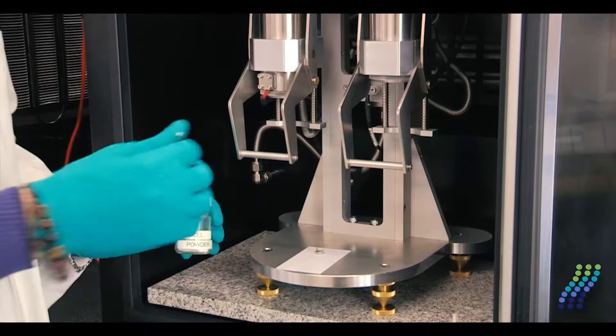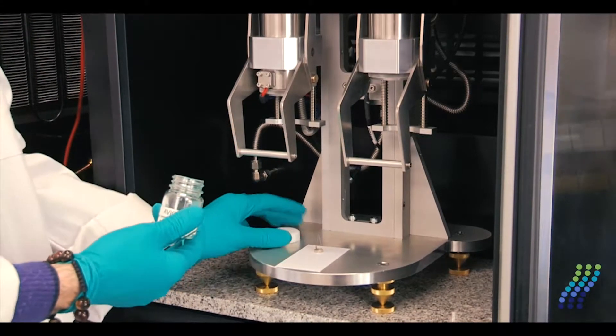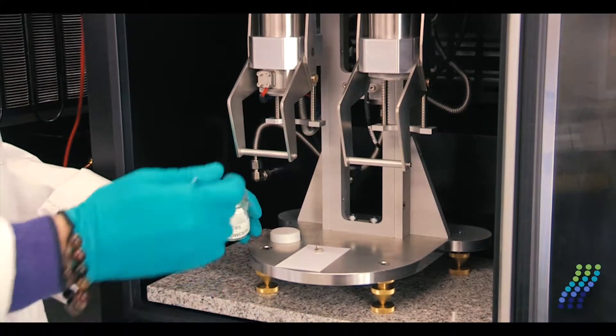I use a clean spatula to move some of the sample from the container to the sample pan.